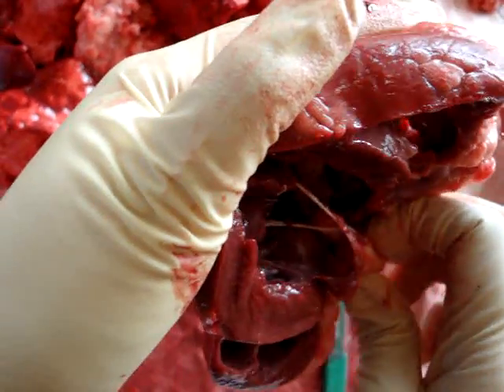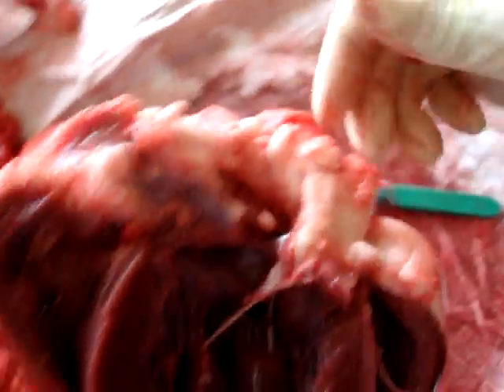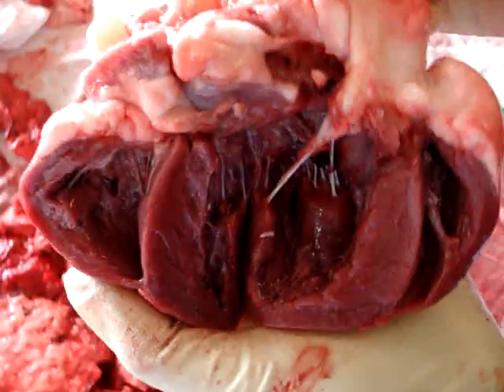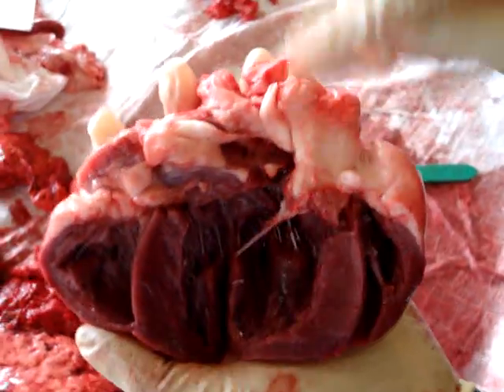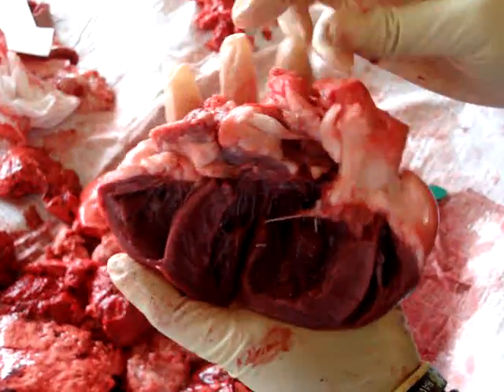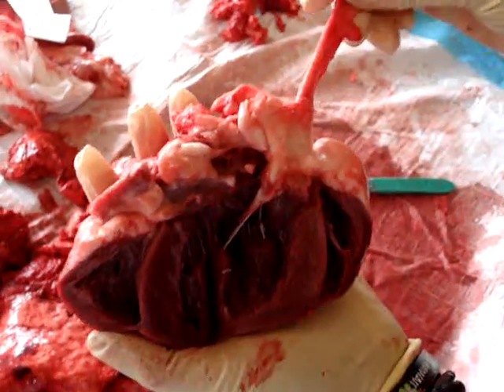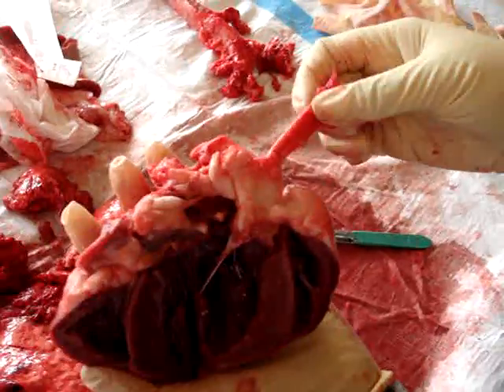Through your semilunar valves, which were right here but they got cut. This is your aorta with the aortic trunk ascending, and it goes to descending — here where everything branches off.